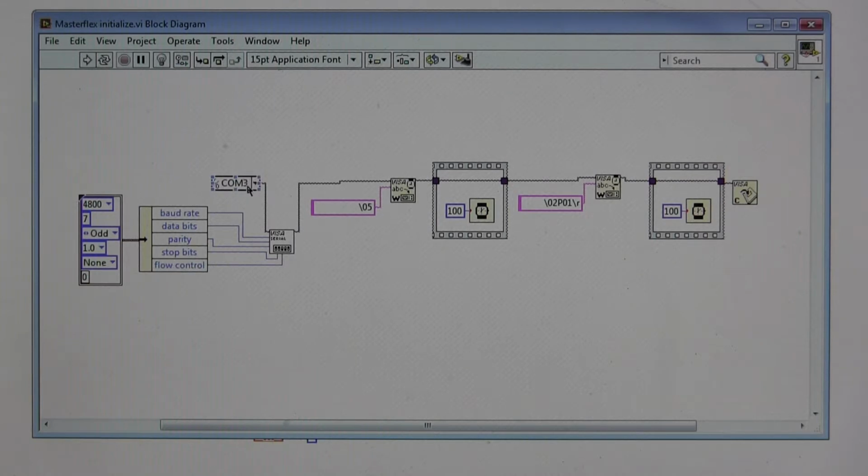Another key setting is COM3. Now in our case, we have several COM ports. This really depends on your hardware. COM3 is simply where we connected the physical wire to our box. You will need to change COM3 to your own setting to make this work for you, or change this to whichever COM port you are working with.